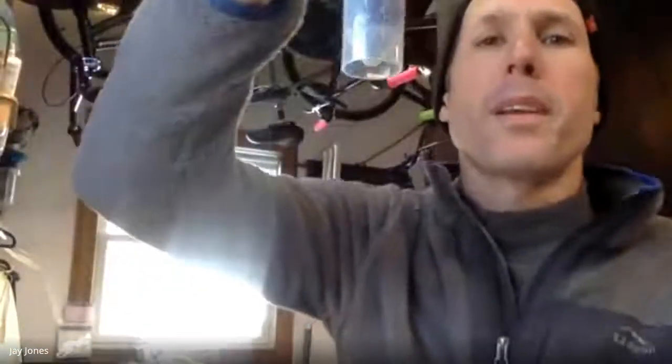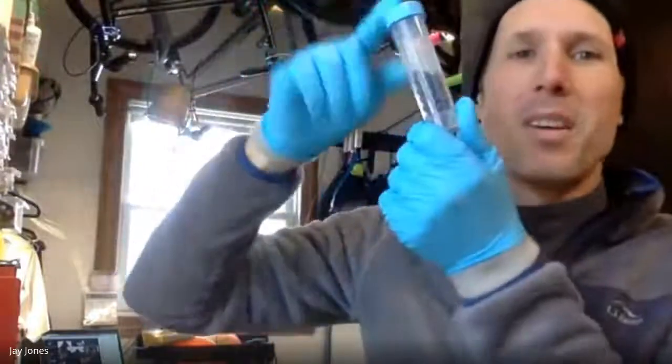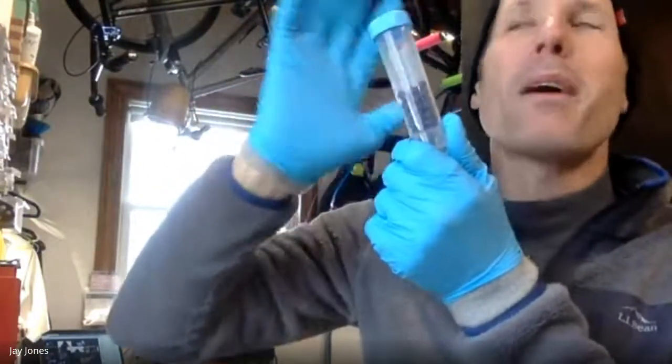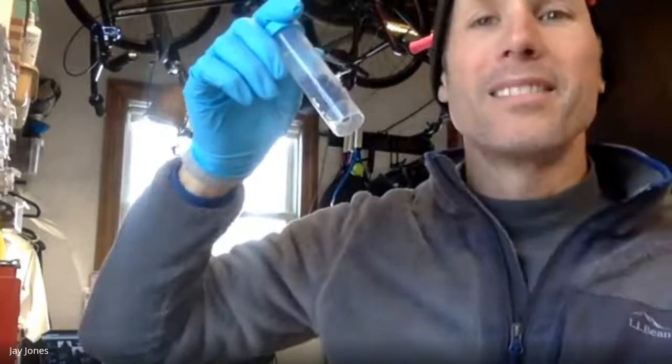So what's up with these? Why do we do these at all, right? Oh, hold on. Why do these at all? Why do I have a vial just with glass beads? What's the point of that? Because it's your control. What's that? It's a control. It's your control.